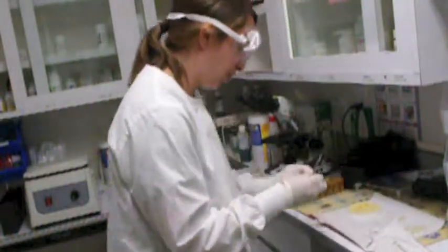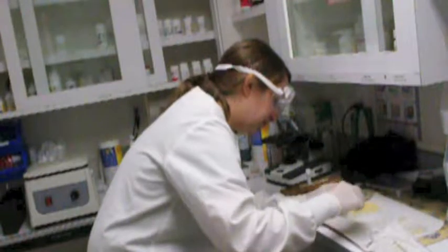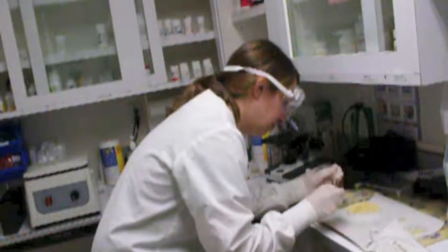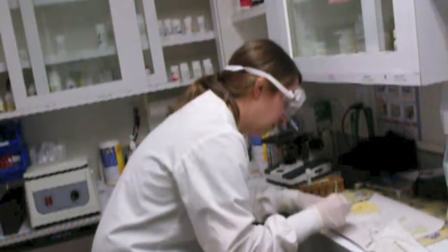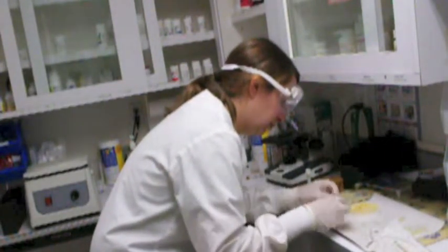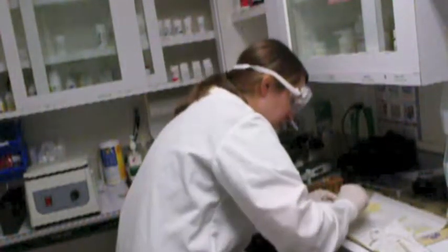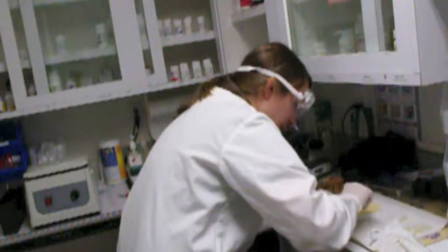Okay, so first my penicillin. Okay, so I'm going to place my penicillin in the area of growth there.